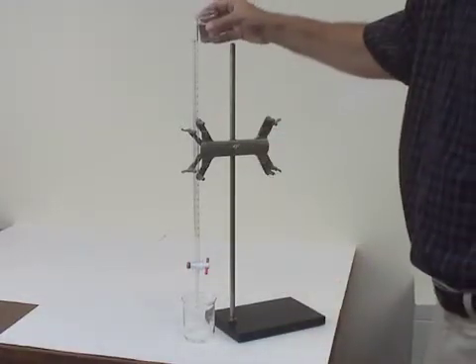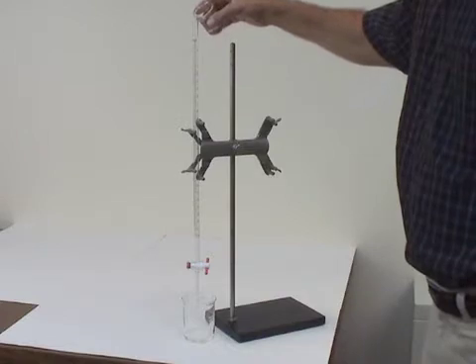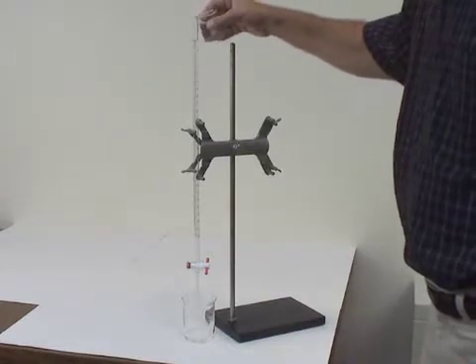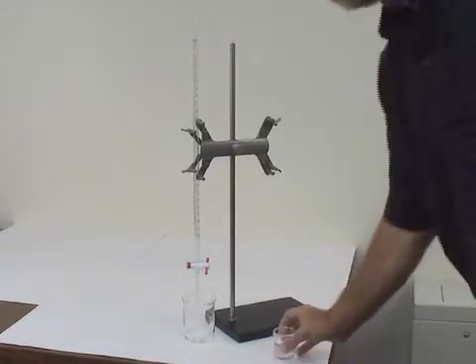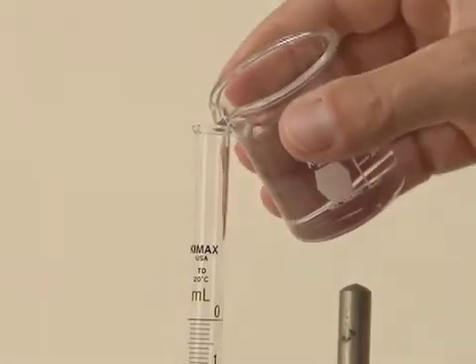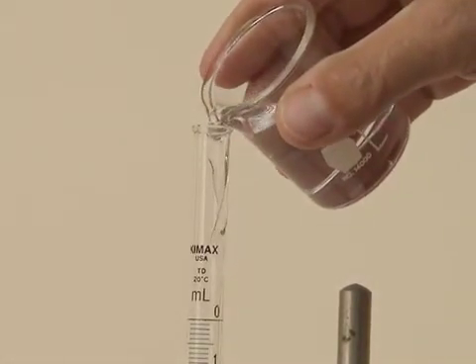you should rinse it with several small portions of the titrating solution. You should do this with a small beaker that contains this solution. You can now fill the burette with titrant. You should also remove any air bubbles that may be in the tip of the burette.